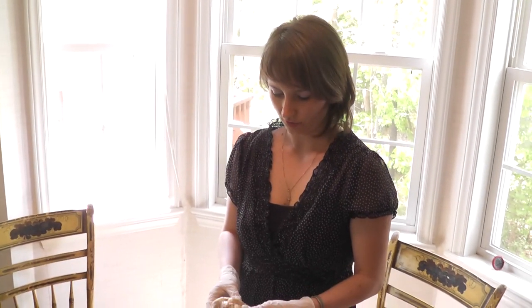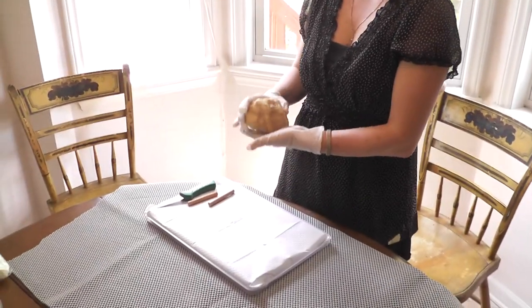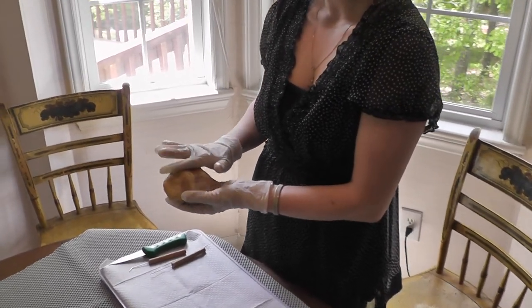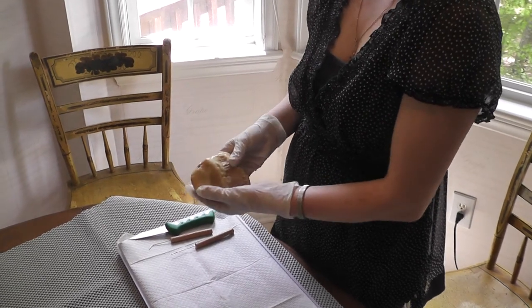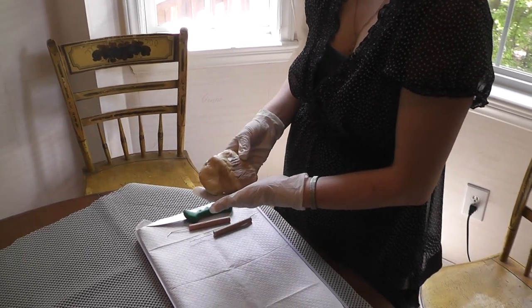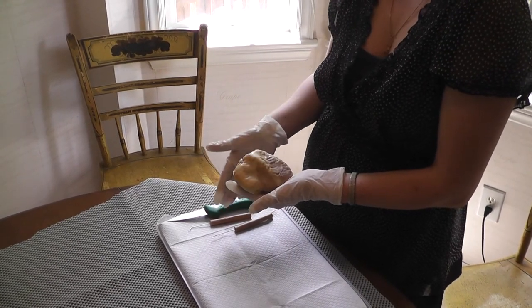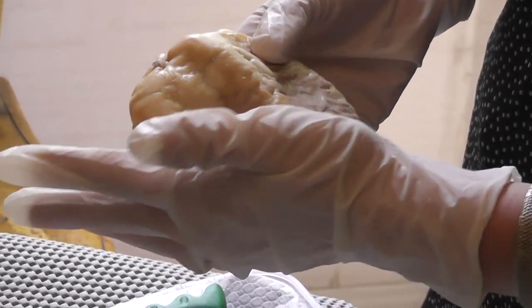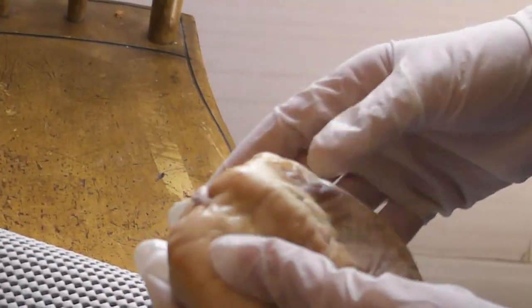This is the video for the sheep heart dissection. So first let me do the orientation of the heart. This is the sheep heart in my hands, and this is the anterior or ventral side of the heart. The way you can tell that this is the anterior or ventral side is because all the major blood vessels right now are facing away from me. They're in the rear of the heart. So this therefore is the right side of the heart, and this is the left side of the heart.